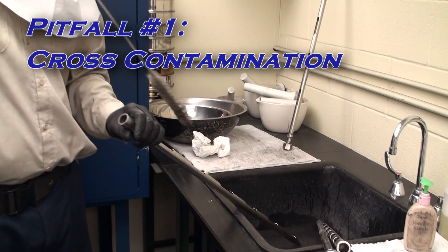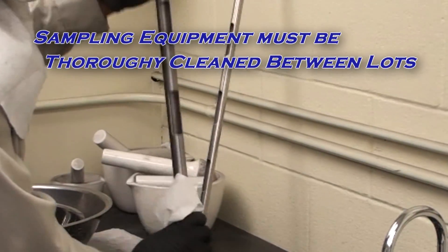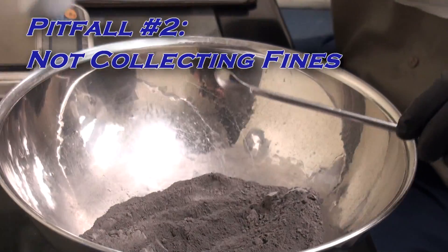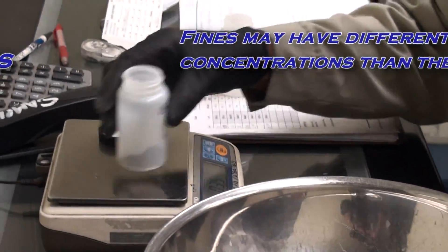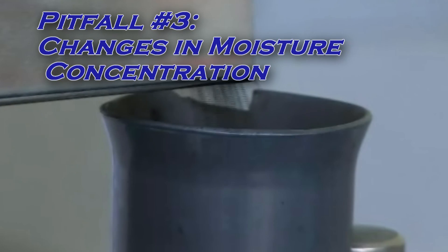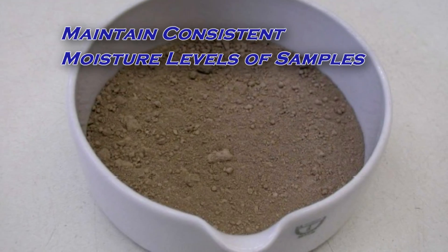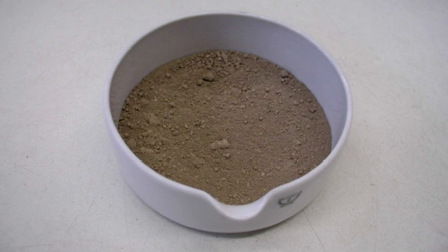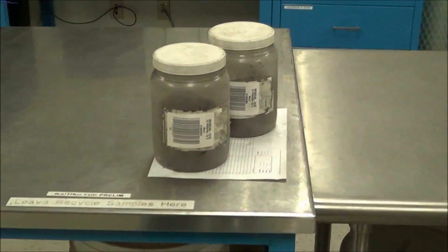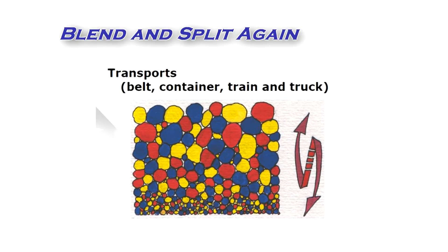Cross-contamination from one sample to the next could occur if sampling equipment is not cleaned adequately between lots. Care must be taken to collect all of the dust when crushing, grinding, or handling fine materials, as some dusts have different metal concentrations than the bulk. Fine particles may also pick up or lose moisture while passing through sampling equipment. Although they may not appear wet, they may contain enough moisture to affect results, so this should be accounted for. When samples reach the assay lab, they may have segregated, so the test sample should also be blended again and split properly.